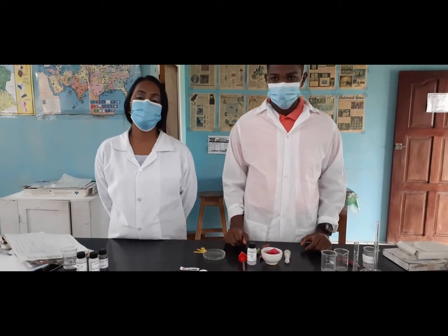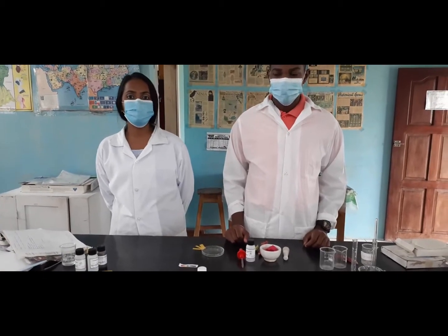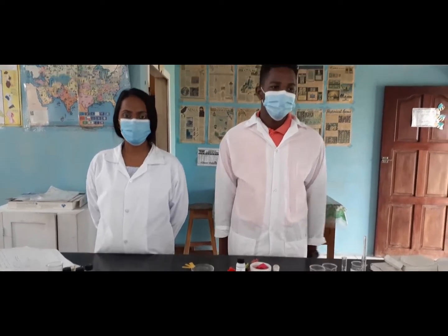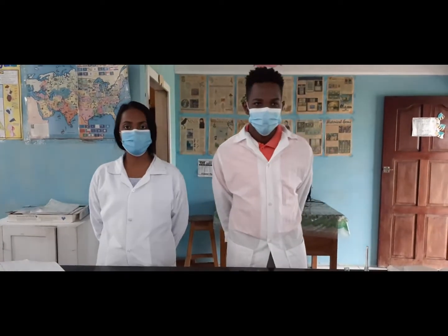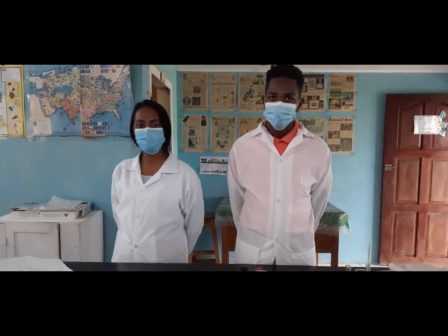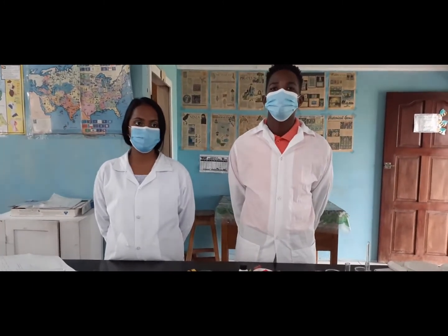Good afternoon. Based on our topic acid base, salts and gases, we will be presenting an experiment today. The title of our experiment is Acid and Bases. Our aim for this experiment is to create a natural indicator.